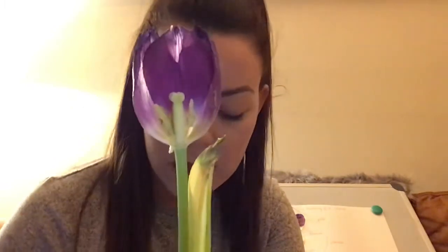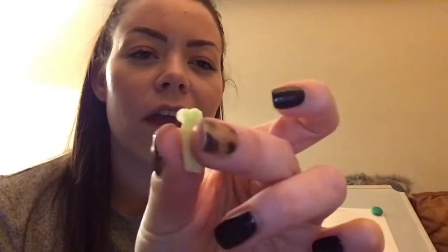Now, there's another really important bit in the flower, and it's the bit right in the middle there that's kind of got that cross shape on top, and that's called the carpel. So I'm going to have a go at trying to cut that out now. The carpel. Oh, pollen is going everywhere on my little table here, and I've managed to cut it out.